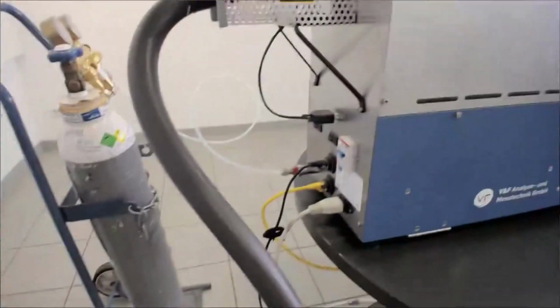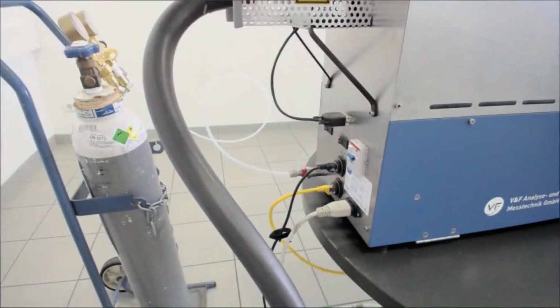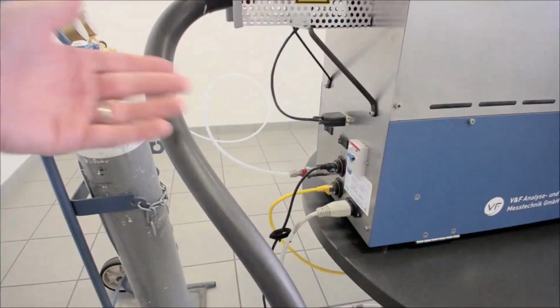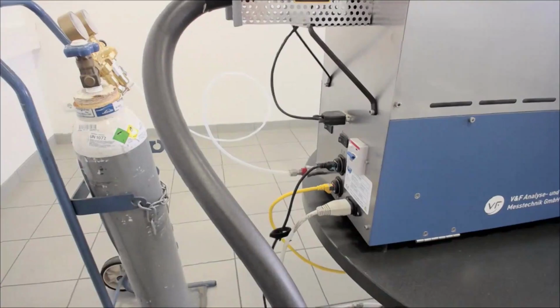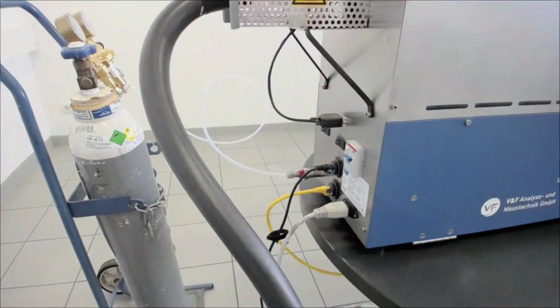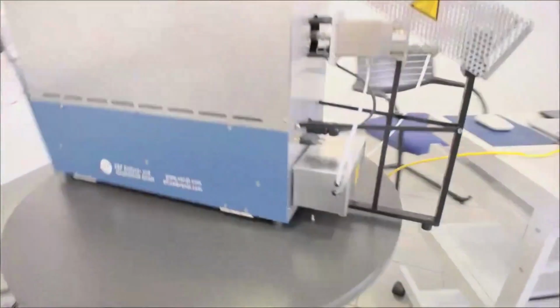Then we have a connection for the 100% oxygen bottle. This is this one here. So in order to guarantee that we have full conversion of sulfur compounds into SO2, what we do is we supply a small amount of oxygen to the gas oxidizer, which will always be present in the sample gas stream, so that even when on the engine exhaust side there is no oxygen left, we still get oxygen for the sulfur conversion. What we still have here is another connection for heatings. And now I'm just moving to the front side.